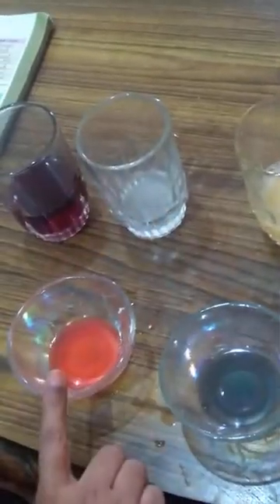Now what we are going to do is, this is soap solution. We are going to put some of it in hibiscus or china rose solution. What is the change children? This turn into magenta color. And this turn into green color. So this is what it tells. This is an indicator which tells whether this was acid. Because it turned magenta color. And this is a base. Because it turned green color.